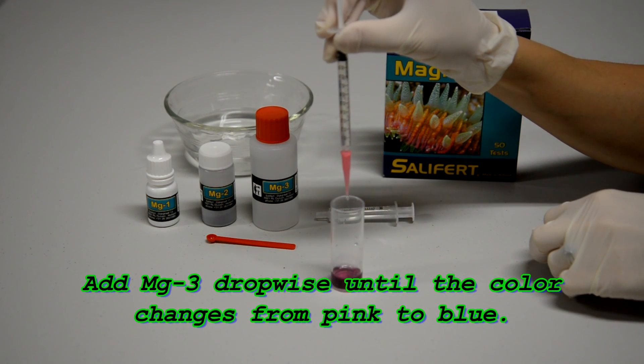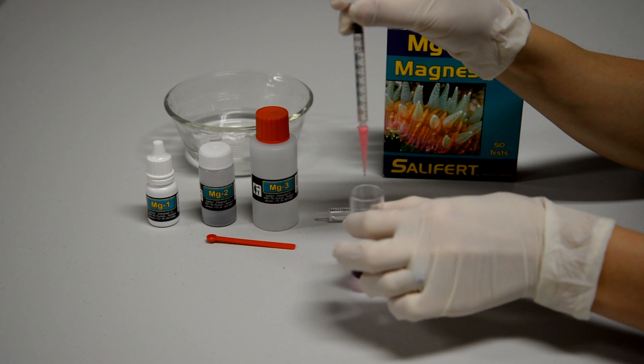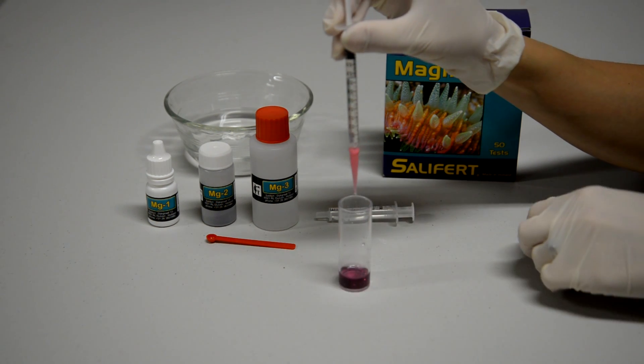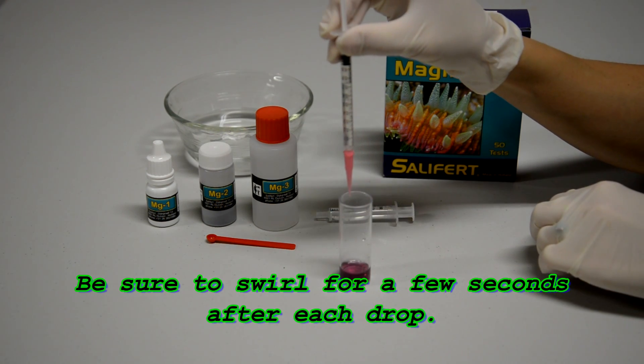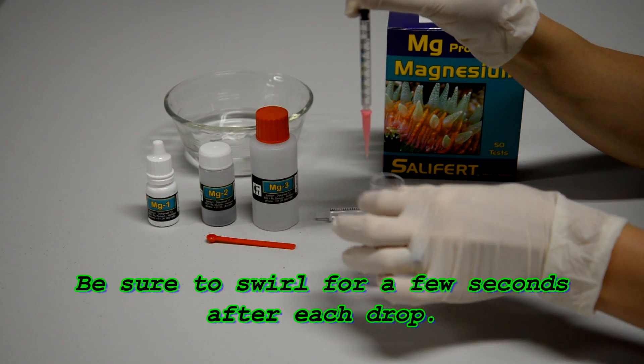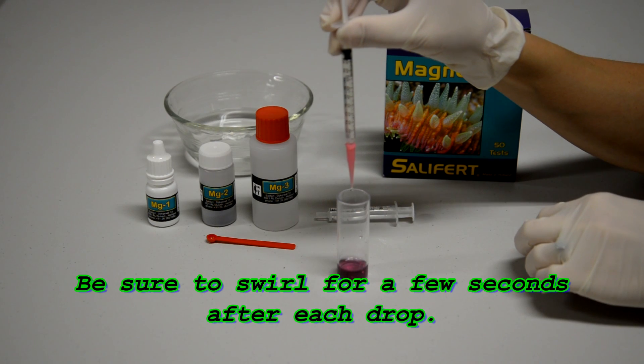And as you go, you add dropwise to your container, shaking it for a couple seconds in between each drop to make sure everything gets mixed up. And you just keep going until your sample actually turns blue.